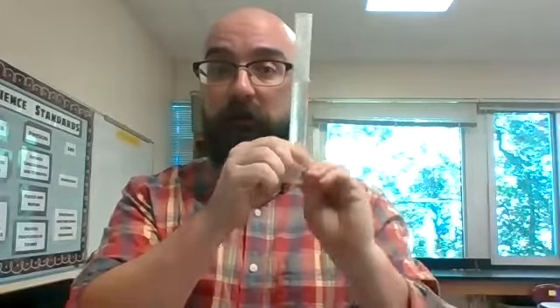So let's say 21. So if we started at 20, we put the marble in and it went up to 21. What's the volume of the marble? 1 milliliter. That's a pretty precise measurement, especially compared to how we were doing it a little bit earlier.